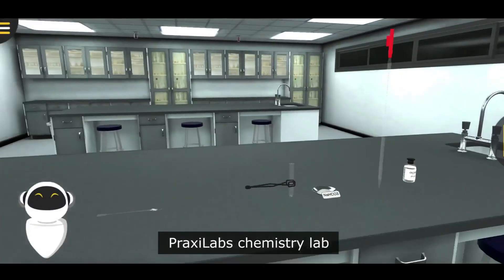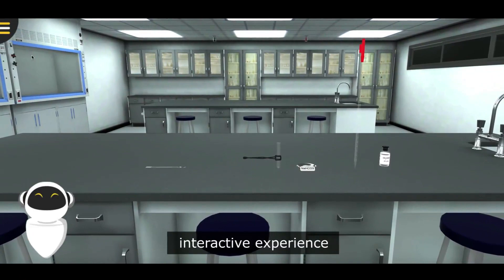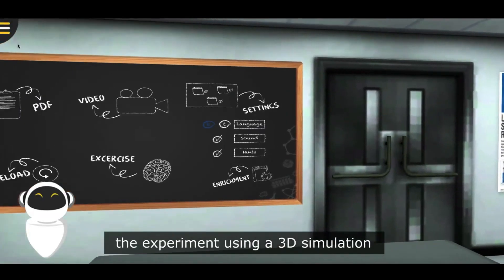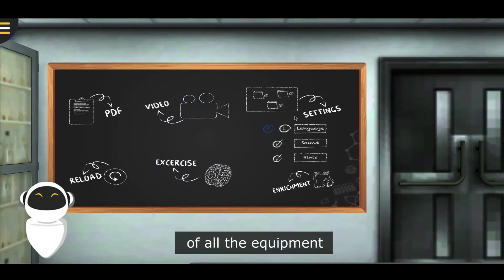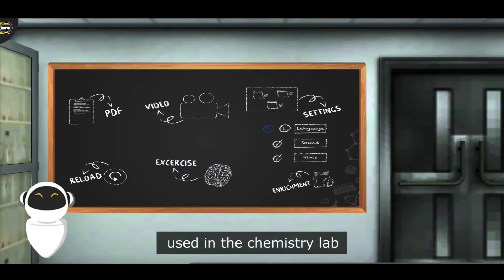PraxiLabs Chemistry Lab provides you with an interesting interactive experience where you'll be able to conduct the experiment using a 3D simulation of all the equipment, tools, and materials used in the Chemistry Lab.